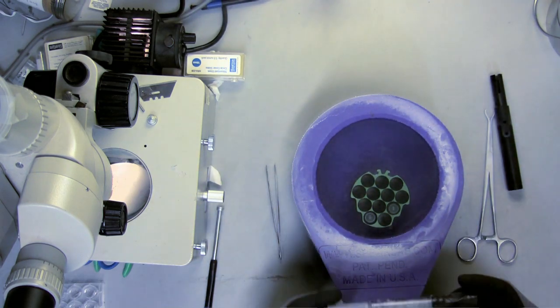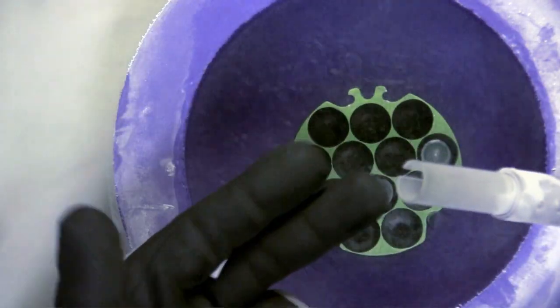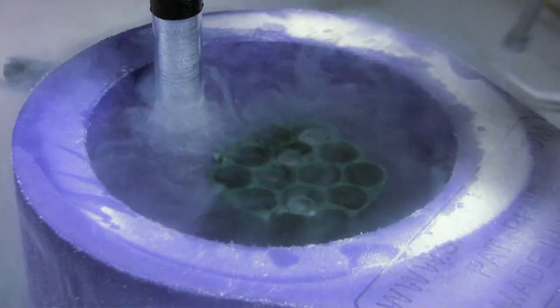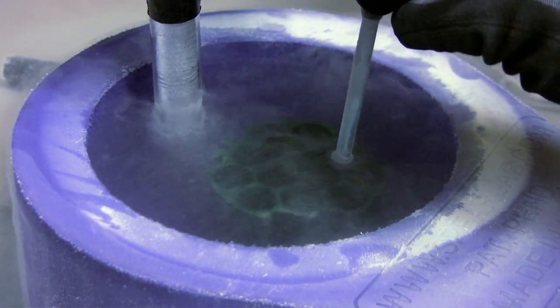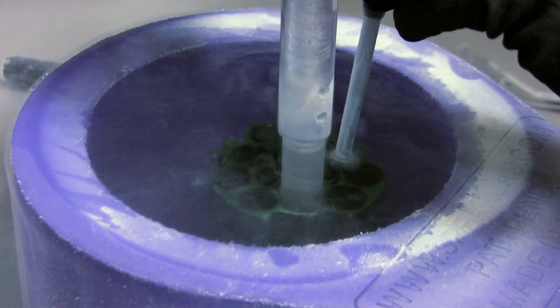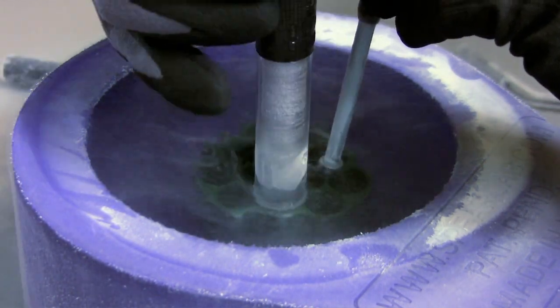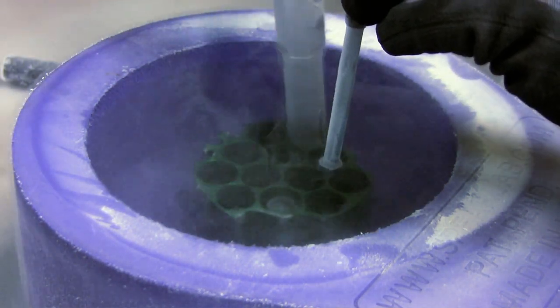For capped samples, use the white tool with the wider opening. Once cooled, place the tool directly over the cap and give a twist at the bottom. You can often hear a click as the base seats into place.